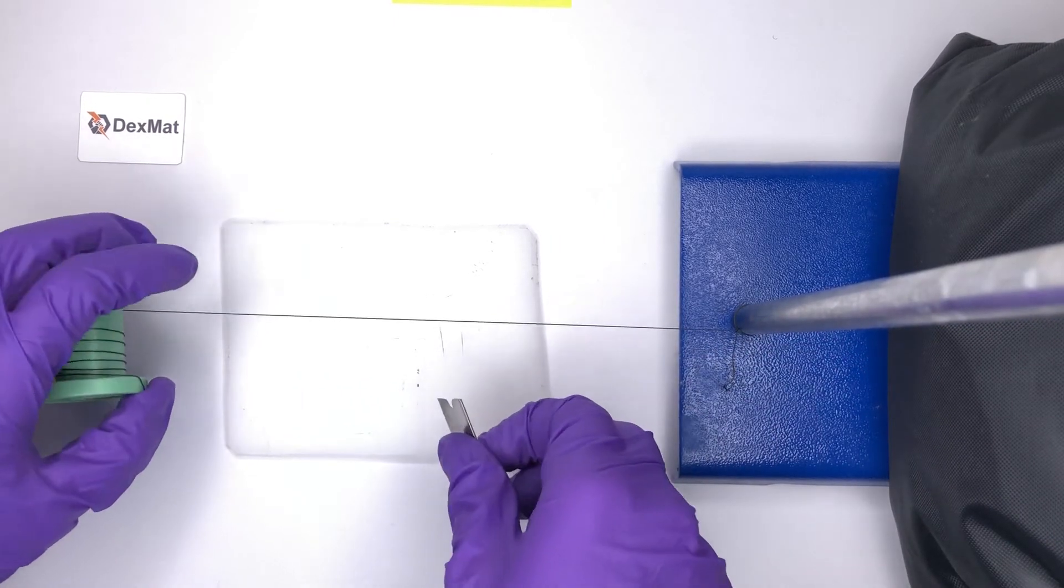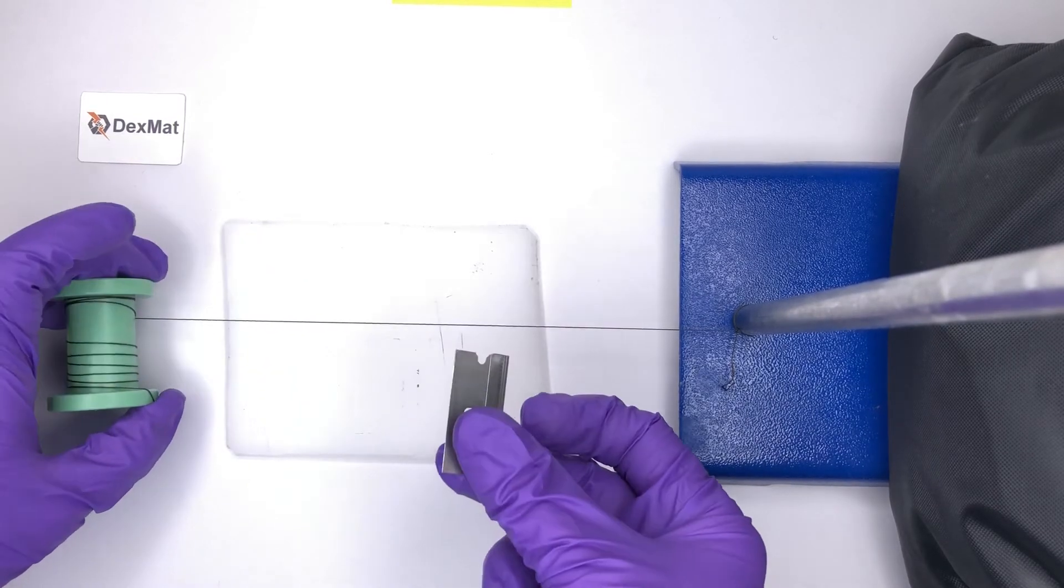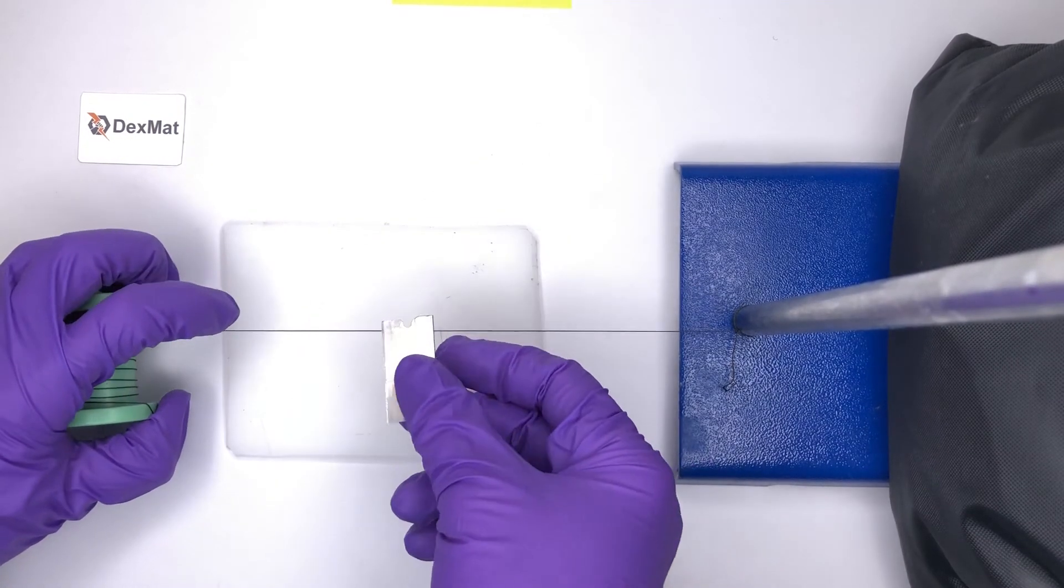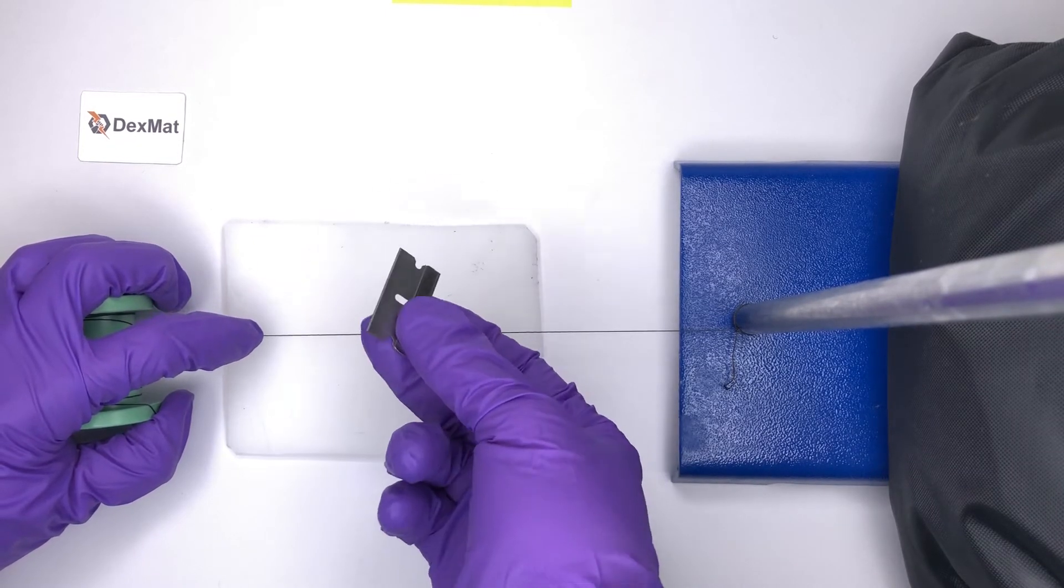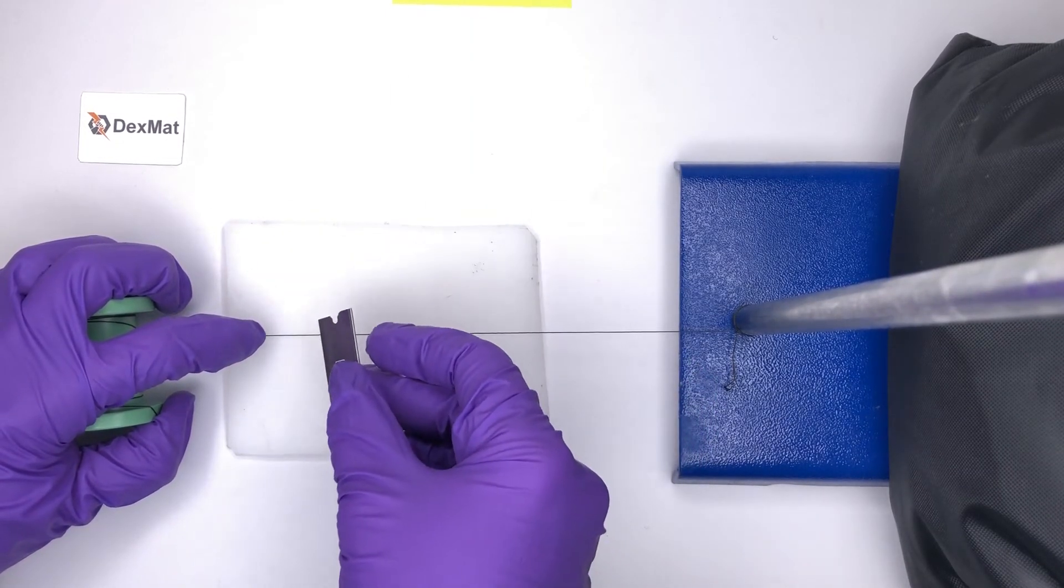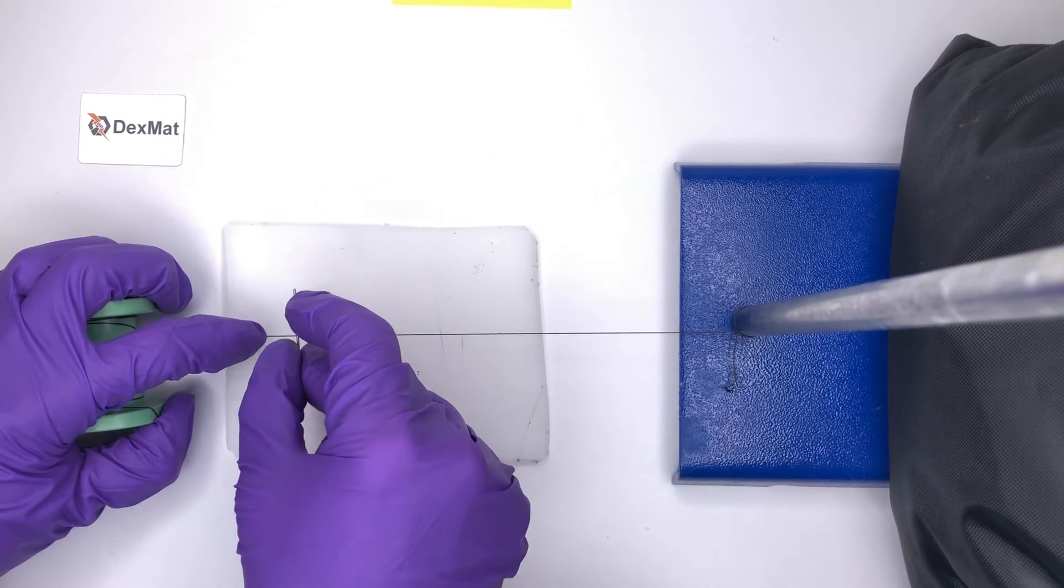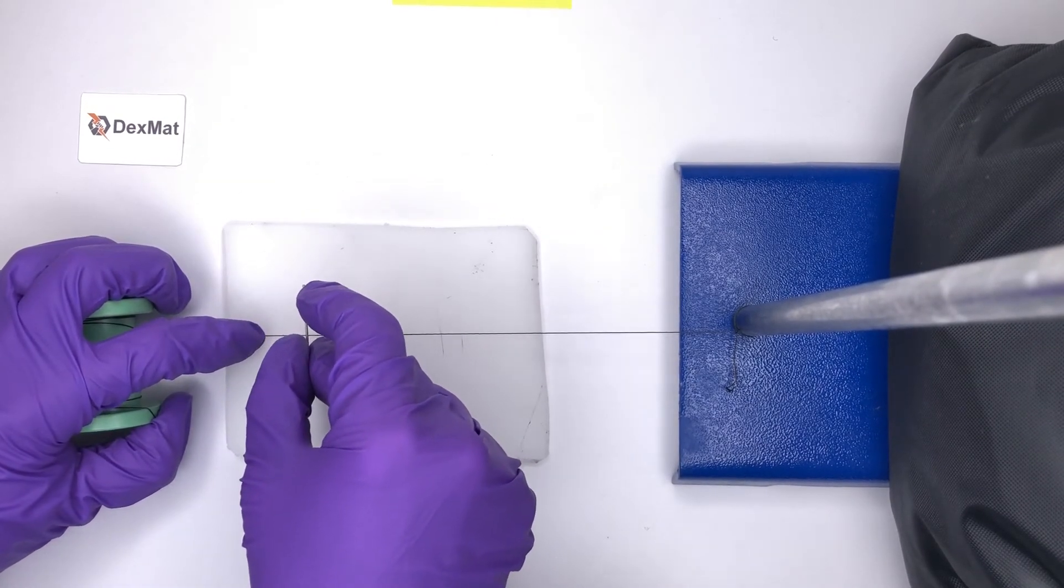Then, when it's under tension, cut it with a razor blade against a soft surface such as plastic that will let you indent into the plastic to some degree.